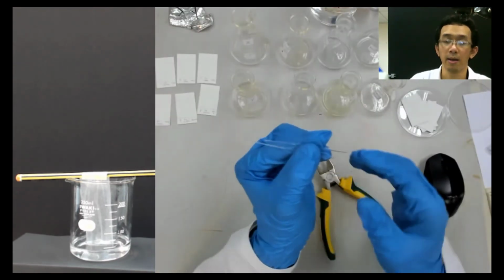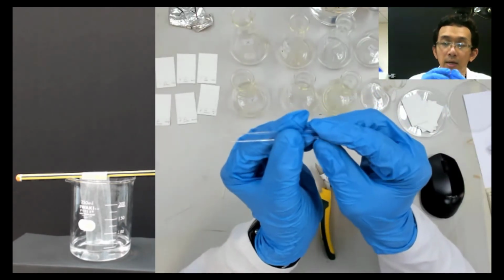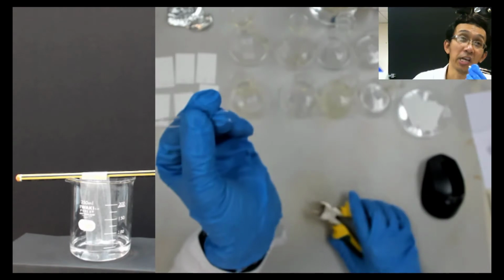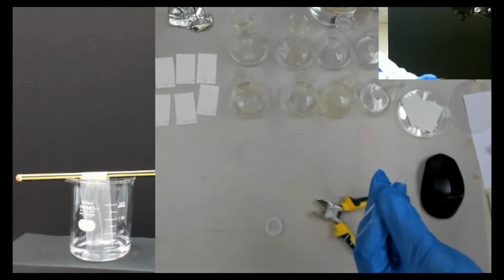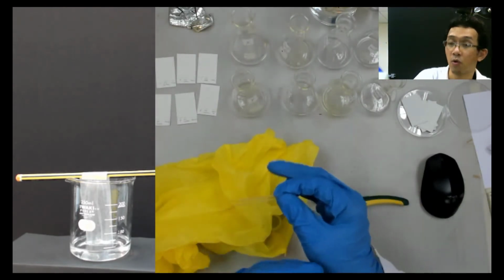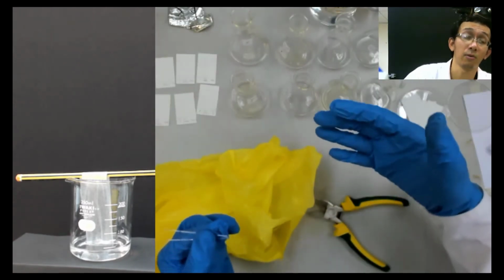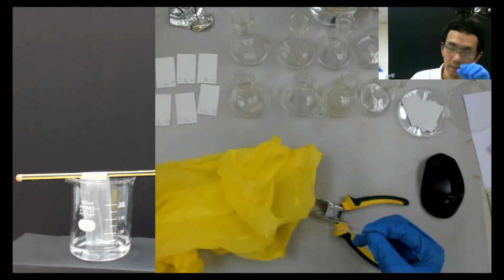Okay, I will break that thing. But because this end is very difficult to break using hand, and also it's bigger than this, when you try to use this plier to break it, it will shatter. The glass will shatter everywhere. So it's important to have some way to prevent the shards from going all over the place, because sometimes they can get into your chemicals, and sometimes into your eyes, and so on. So that's why it's important during the lab.